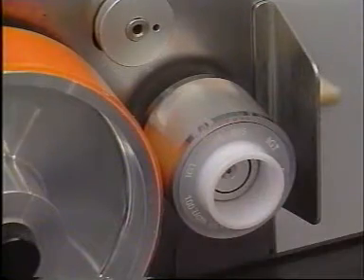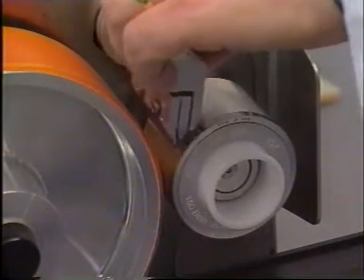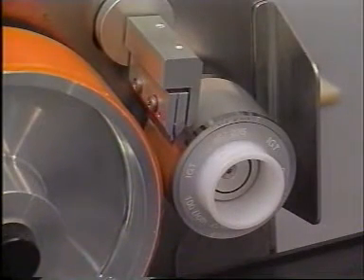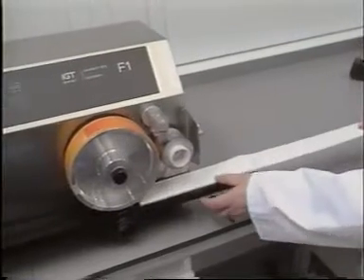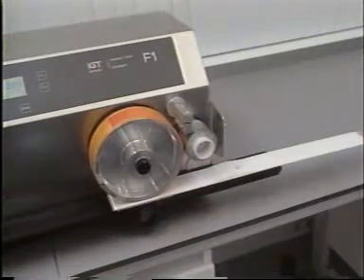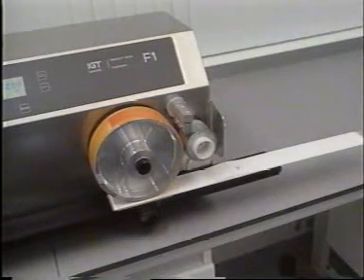The engraved disc and the doctor blade holder with doctor blade are slid onto the F1. The printing form is fitted on the printing form cylinder. The substrate carrier with the substrate is placed on the substrate guide on the right.